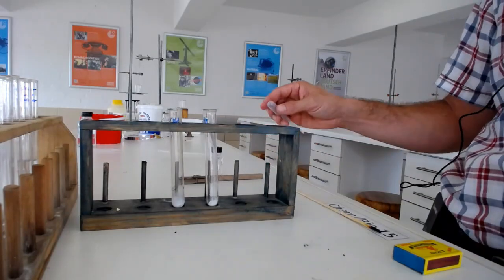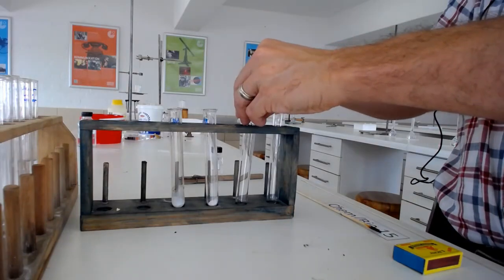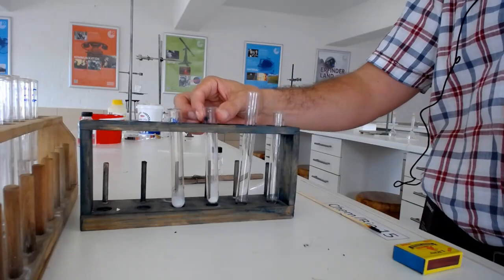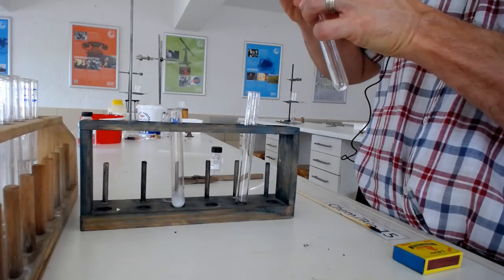I'm going to do it in two different ways. I'm going to take some of it out and dissolve it in sodium hydroxide.